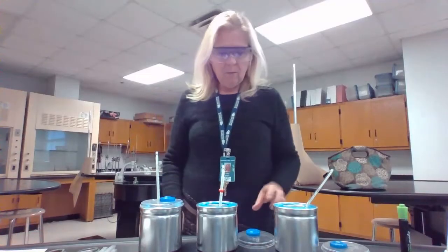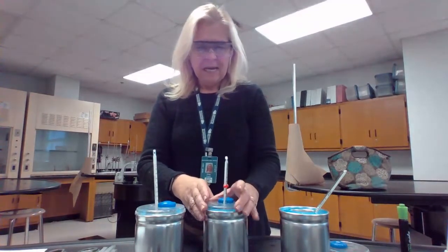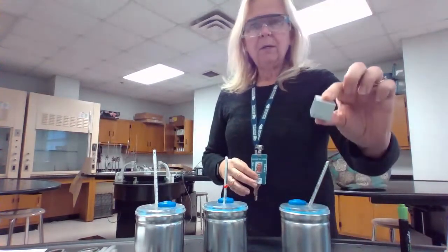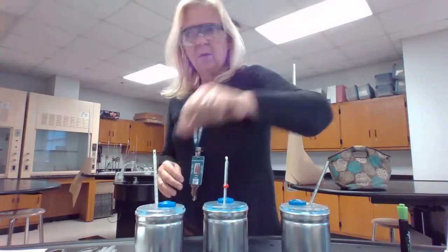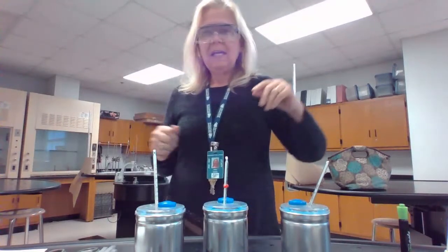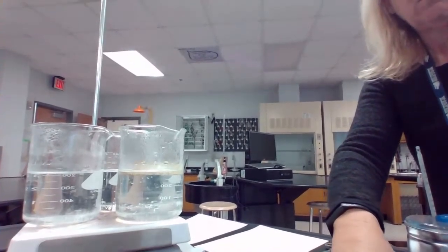Okay, hi everybody. Today we're going to be doing a laboratory, which is a calorimetry laboratory with 3 different metals. And the 3 different metals that we're going to be using are aluminum, brass, and copper. All right, so those 3 metals are going to be the ones that we are going to heat in our beakers. So you can see our beakers on our hot plate here. Those 3 metals are going to be the ones that we heat on our hot plate.